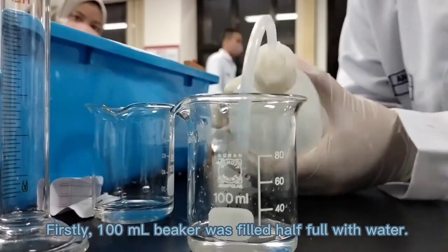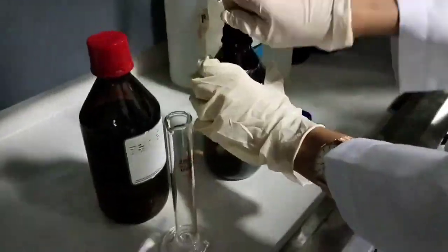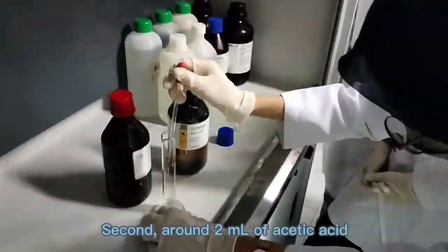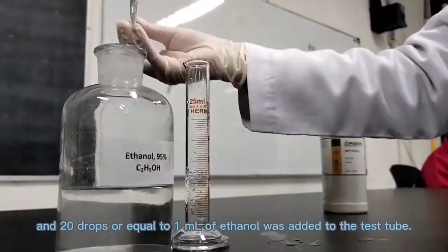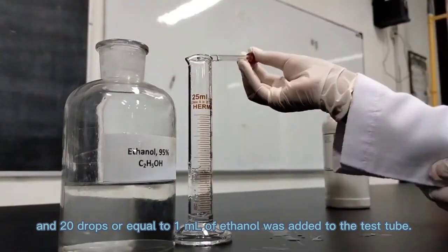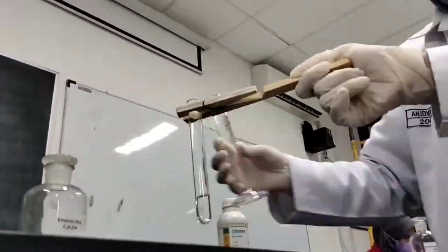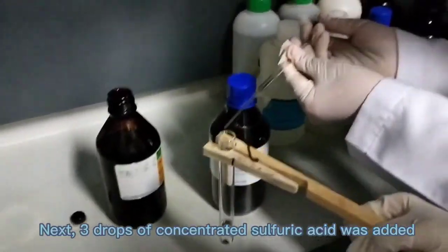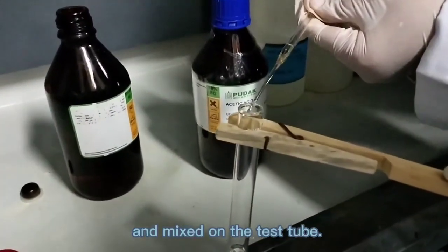Firstly, a 100 ml beaker was filled half full with water. Second, around 2 ml of acetic acid and 20 drops, or equal to 1 ml, of ethanol was added to the test tube. Then mix it. Next, 3 drops of concentrated sulfuric acid was added and mixed in the test tube.